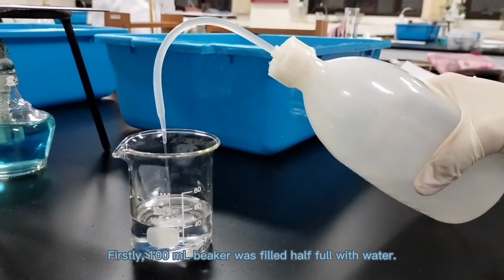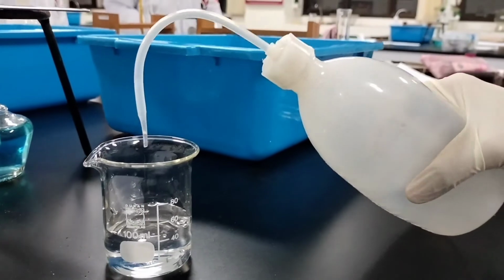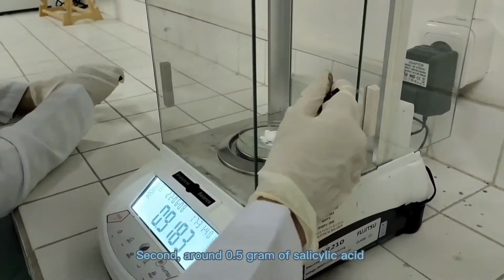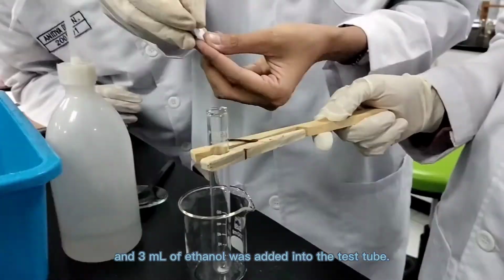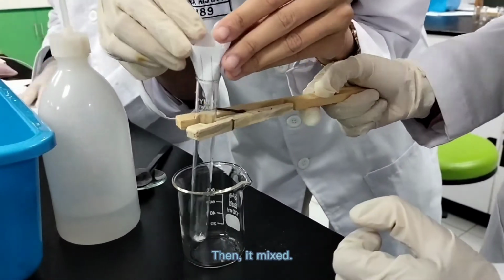Procedure B. Firstly, a 100 ml beaker was filled half full with water. Second, around 0.5 gram of salicylic acid and 3 ml of ethanol was added into the test tube, then it was mixed.